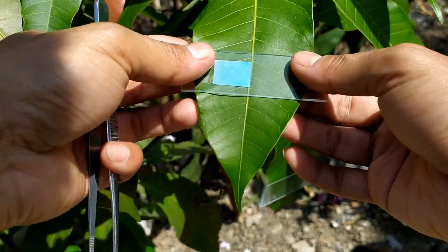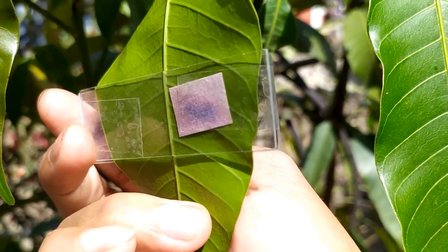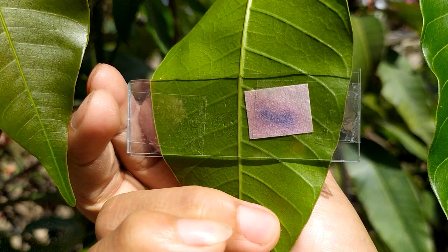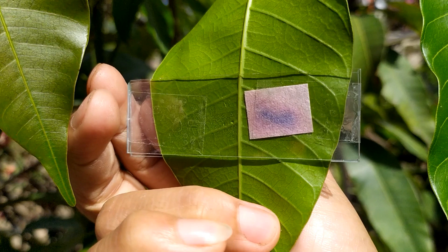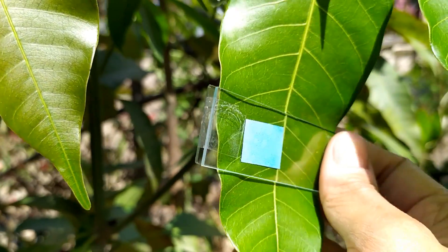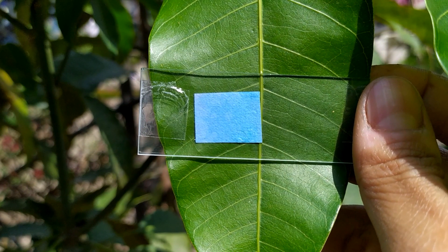Secure the slides by taping them together on both corners using a sticky tape or a pair of paper clips. Leave the setup for a few minutes and observe. After several seconds or minutes depending on the weather, you'll find that the blue color of the paper squares slowly begins to turn pink. If you are using a dicot leaf for this experiment, you'll find that the color change is comparatively much faster in the paper square placed on the lower surface of the leaf. On the upper surface, there is very slow and very little or almost no color change even after several minutes.